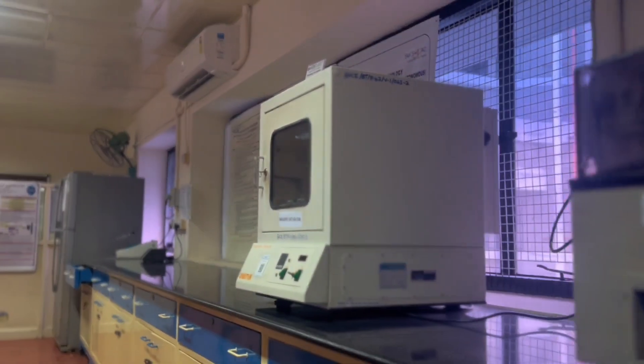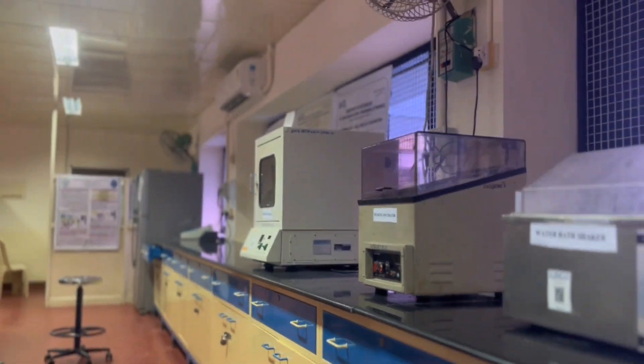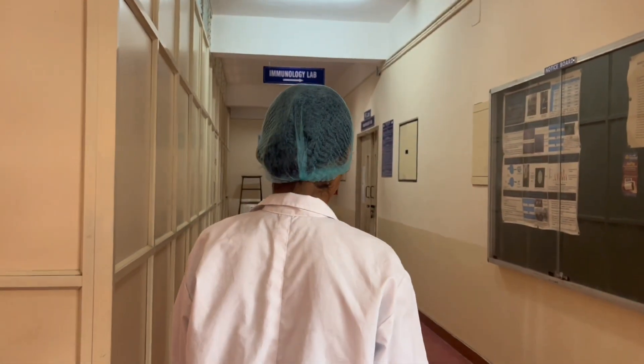This provides proof that our department gives importance to workmanship and also the incredible inventory management that enables our projects to yield better and faster results.